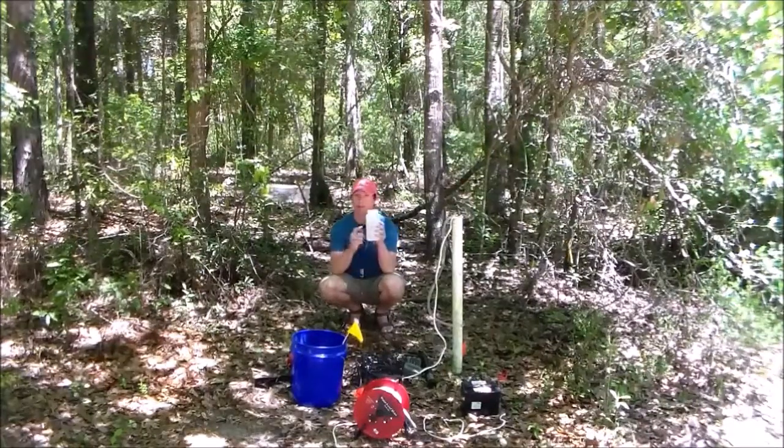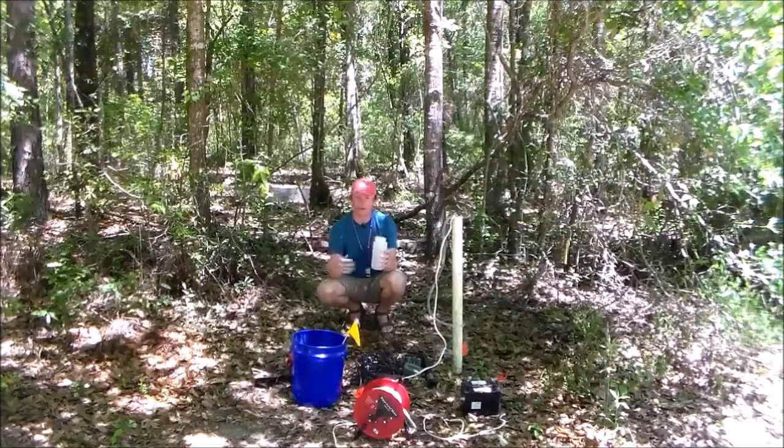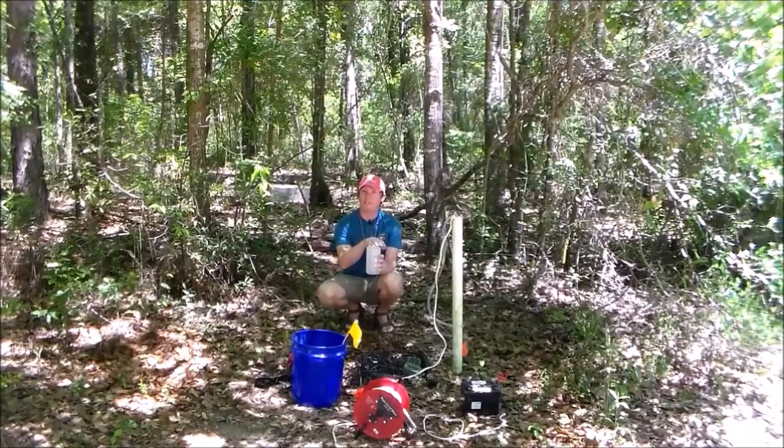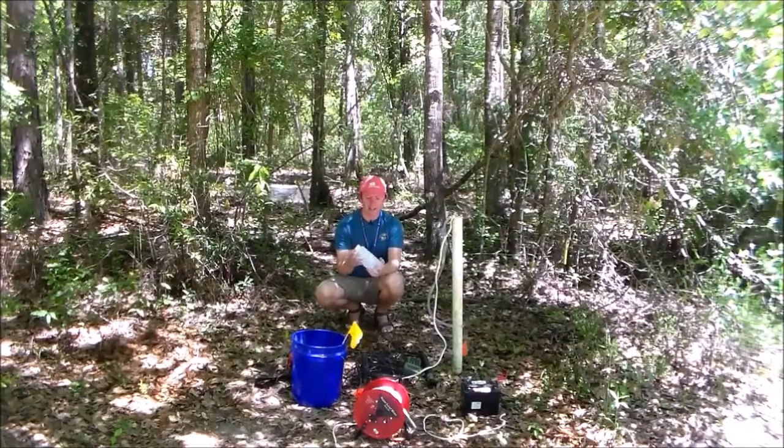We call that headspace. So if you're sampling for volatile organics, which I'm not, you would want to have zero headspace. So no bubbles at all. And that can be kind of tricky and kind of fun. So I don't really have to worry about that.